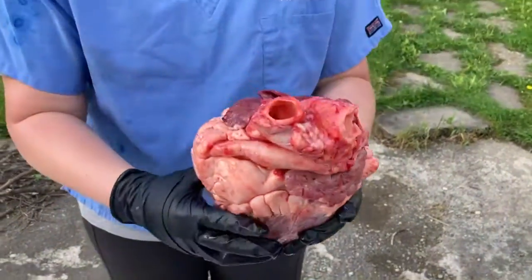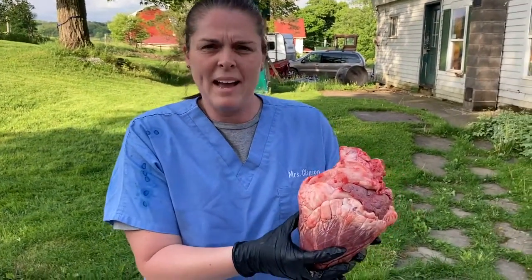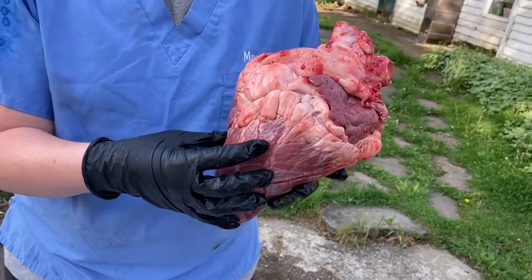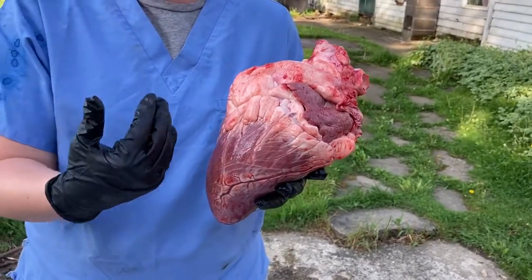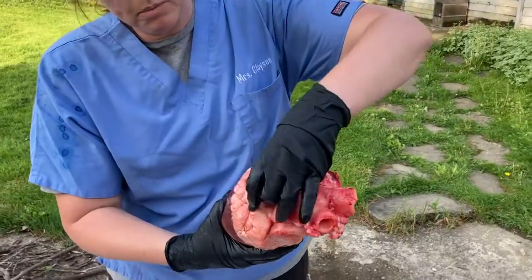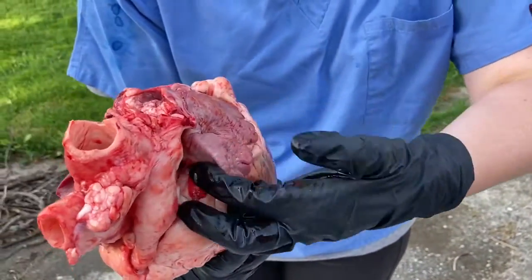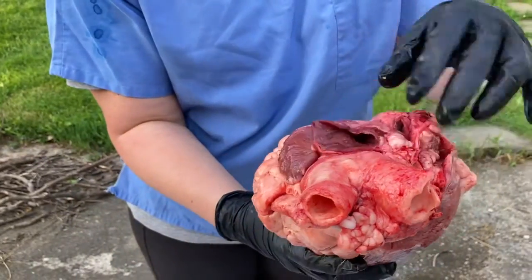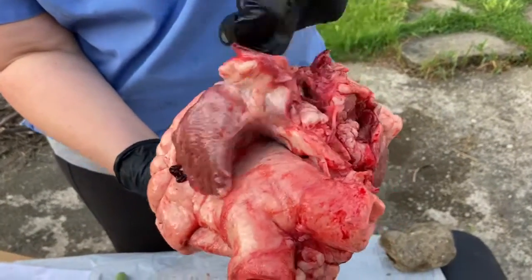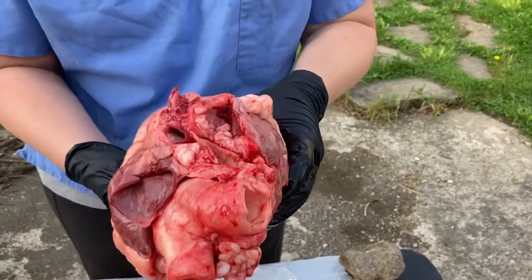It should be, if I was a cow, situated kind of like this. This big part at the bottom is actually the ventricles, and they are larger and more muscular because the right one has to pump blood to the lungs, and the left one has to pump it to the body. These little parts here look to me like sections of a liver, but these are the atria, so that's where the blood comes in. And here's one of the vena cava coming into it, so I can stick my finger right into there. The blood is going to enter through there, and when I cut it open, it'll make a little more sense.